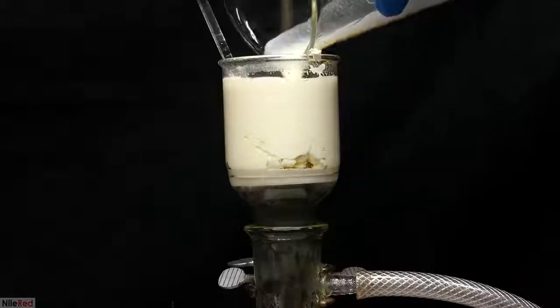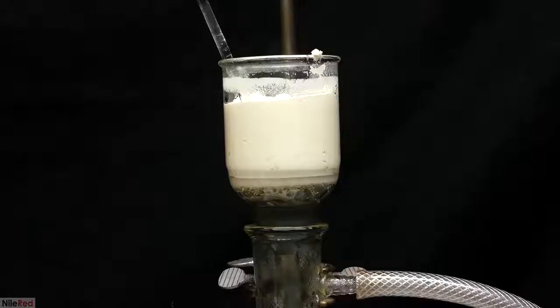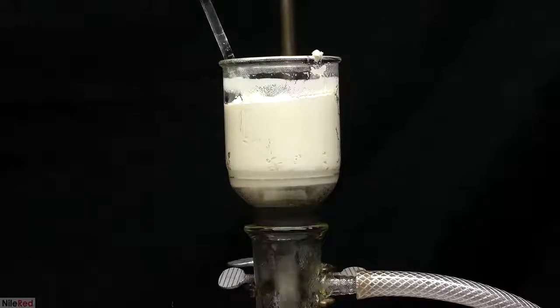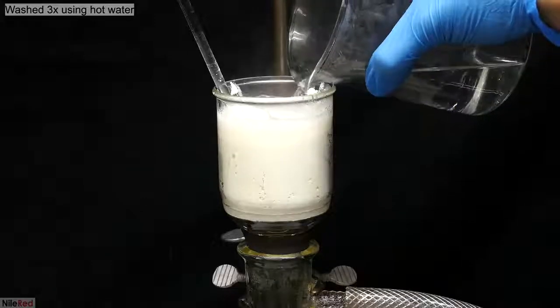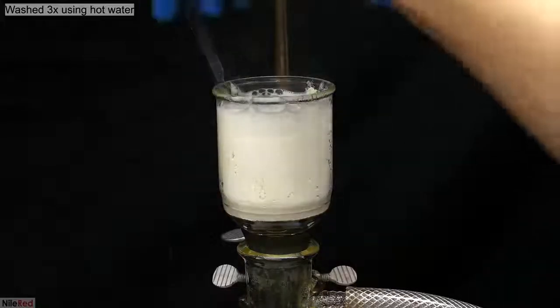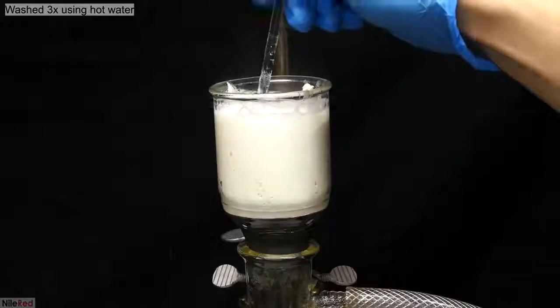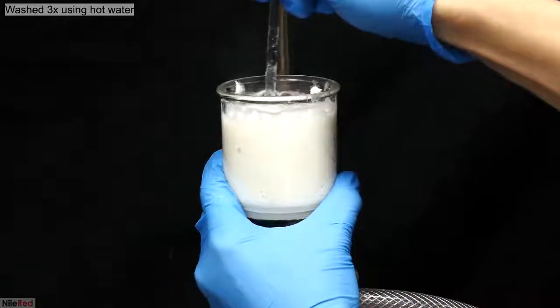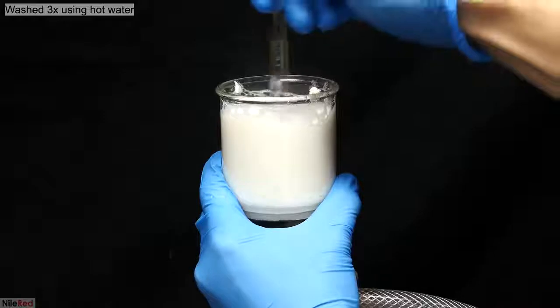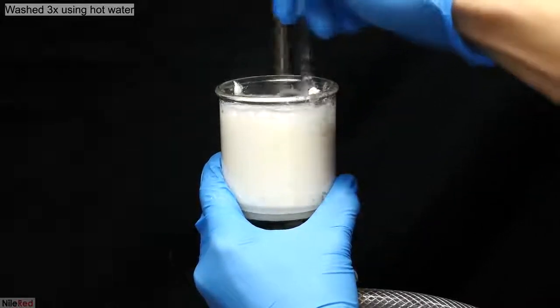A little bit of hot water was used to wash the beaker, and everything was transferred to the filter. I only needed to do this a couple times until the beaker was pretty much clean. I then added some hot distilled water, and using the glass stir rod, I thoroughly mixed things up. Once I felt like I had given the calcium citrate a good wash, I turned on the vacuum and pulled away the water. This washing step is used to clean up the calcium citrate, and I repeated it 2 more times for a total of 3 washings.